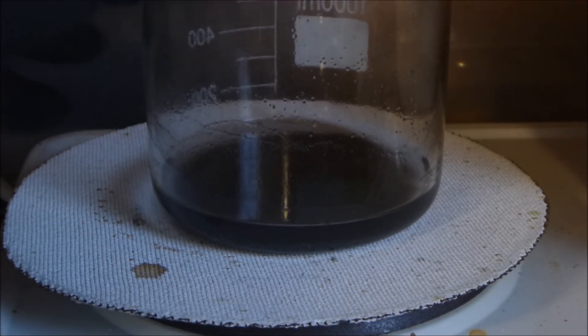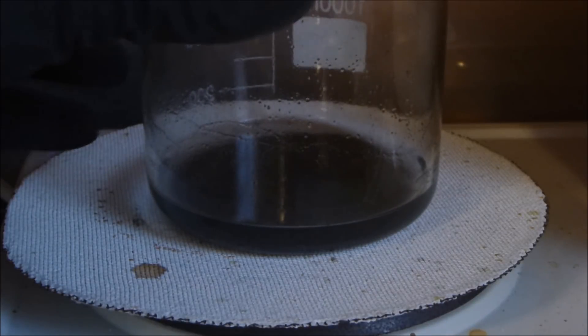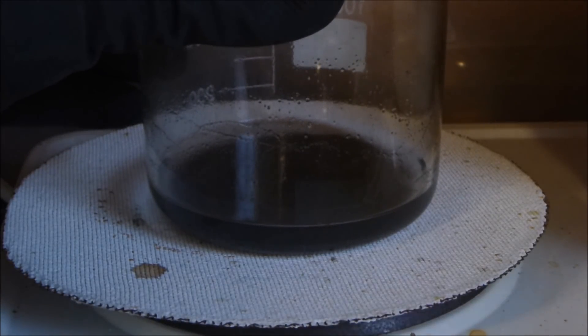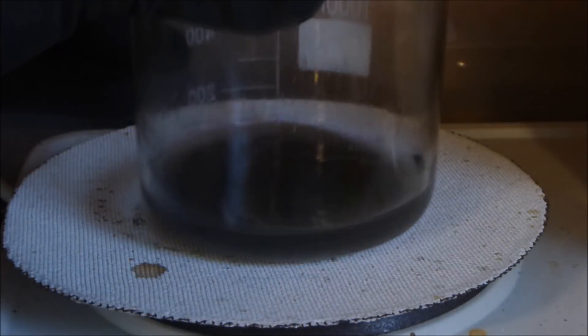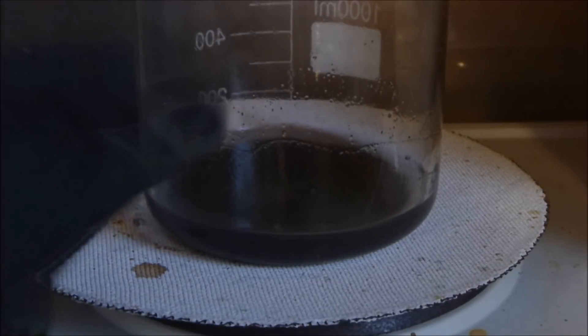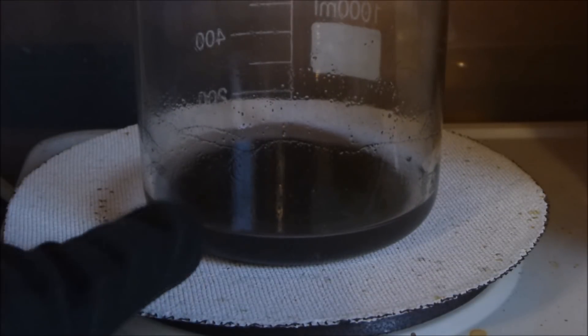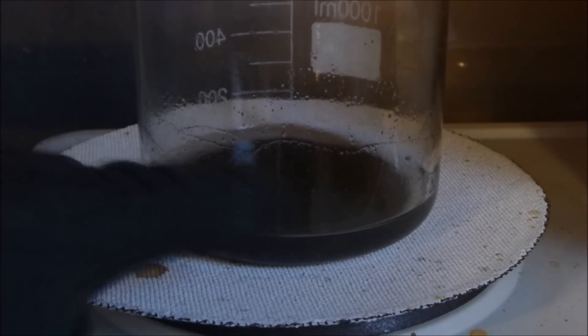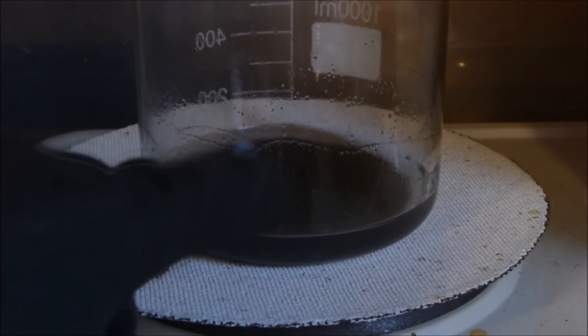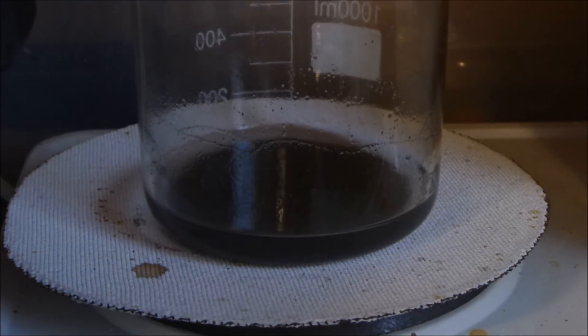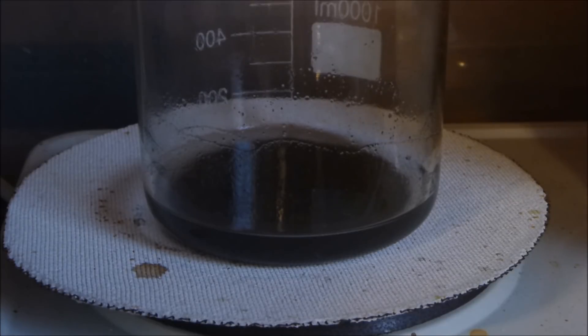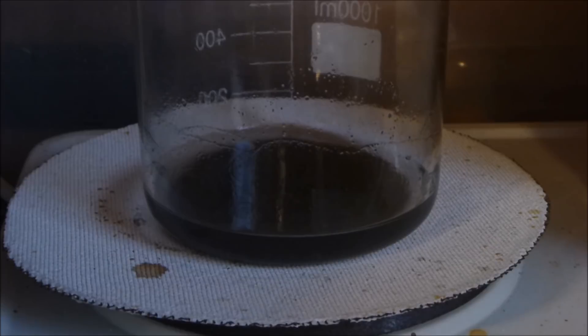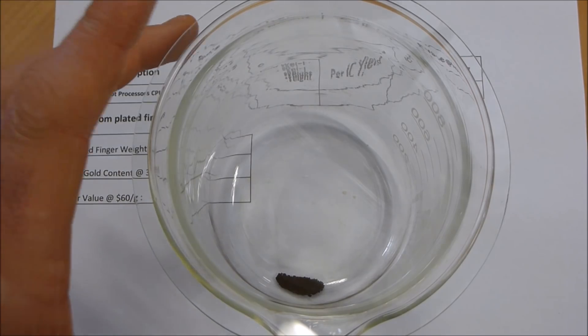Okay guys, so finally finished consuming all of the copper in this mixture using the nitric acid. I've decanted the copper nitrate and washed the excess nitric acid out of this. Next step is we're going to add some hydrochloric acid to this, wouldn't need very much, maybe about as much water as is in there currently. We're going to heat that up to about 70-75 degrees Celsius or so and then start giving it a little bit of nitric acid again in small increments to dissolve the gold that's in there.